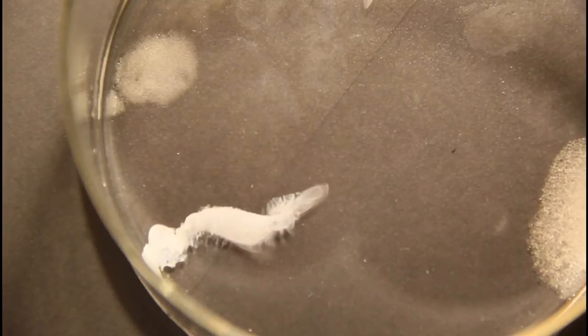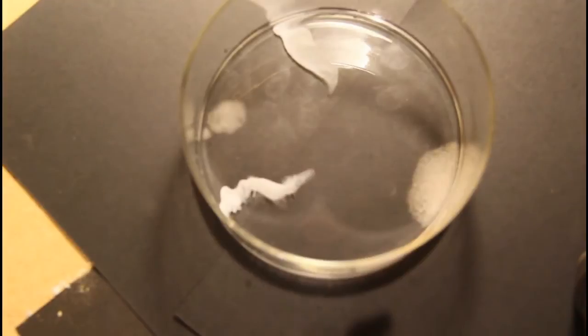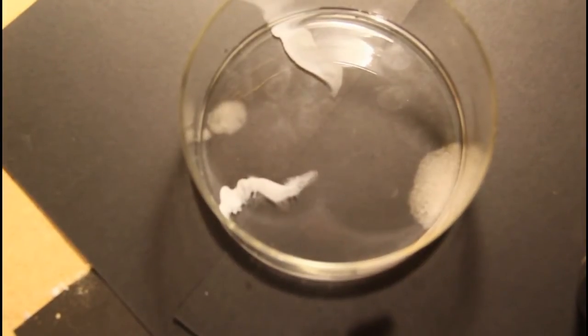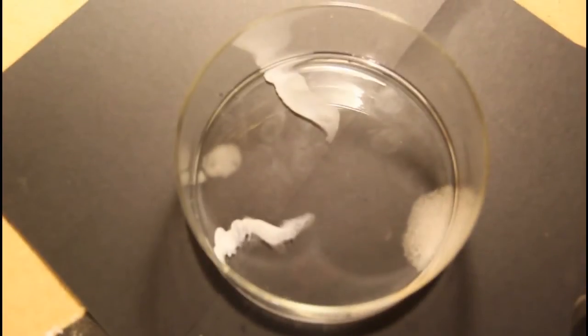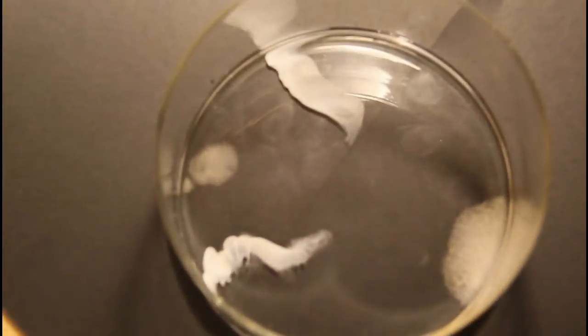And that's from the silver. It's going over on the other side too. Let me back this out. You can kind of see it.